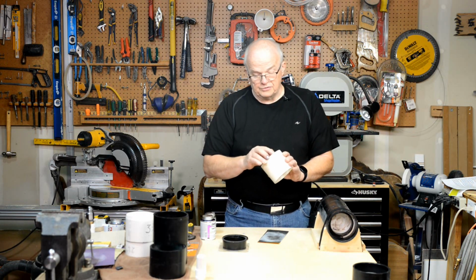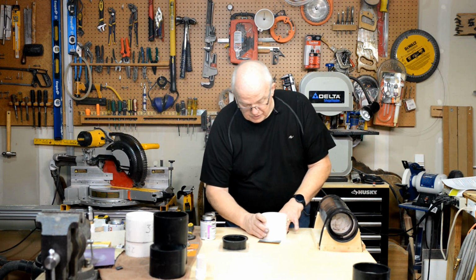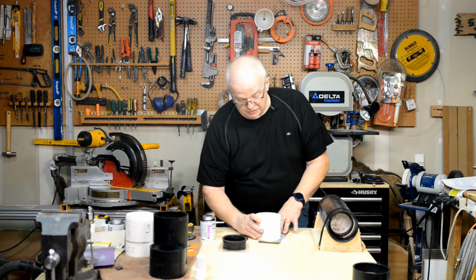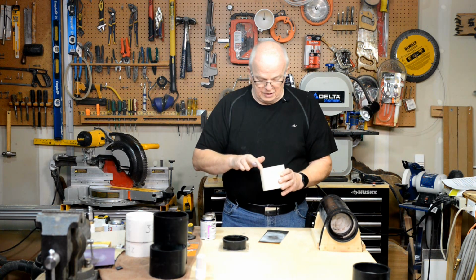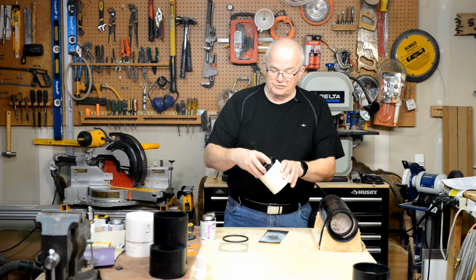And the reason that you want this flat surface like this is because this is going to be the surface that helps establish your vacuum. If this surface isn't clean and smooth, you can develop leaks in it, and you don't want that. Okay? So, very nice. This is the end then that we're going to want to stick this end cap into.